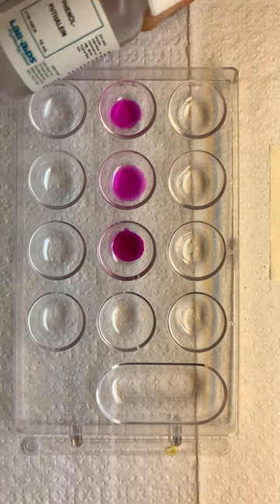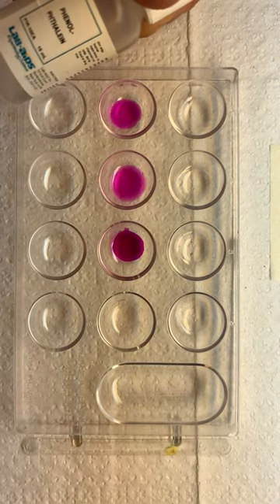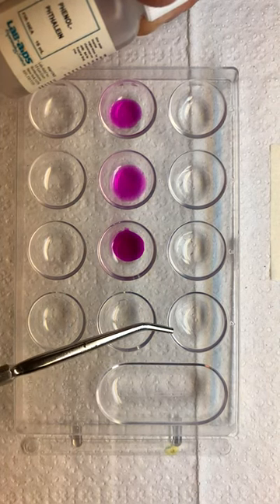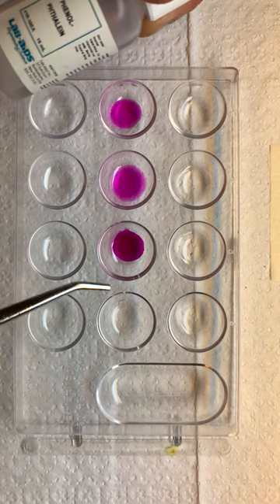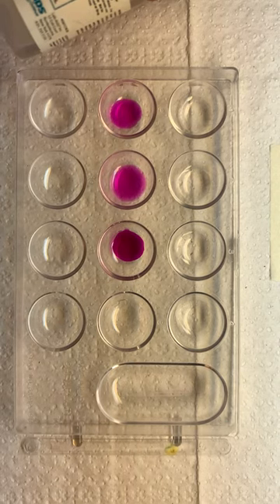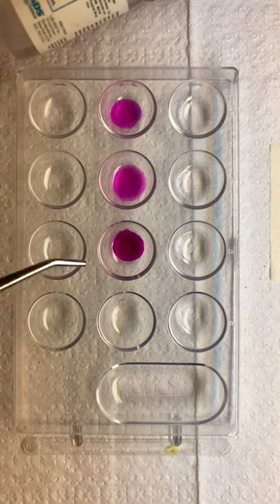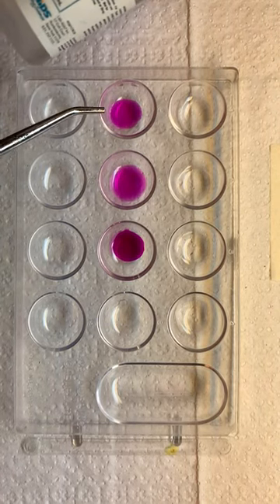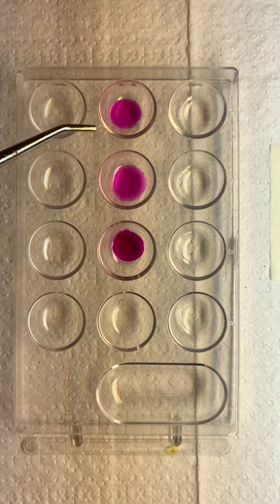Those are bases, so we know that phenolphthalein reacts when it touches a base, as long as that base is between pH 9 and 13. Nothing happened at 7, so we know that phenolphthalein does not detect bases below 9. It doesn't detect bases above 13 that we can see, because we don't have a 14 to test. So the range for phenolphthalein is 9 to 13, and that's where it changed to magenta.